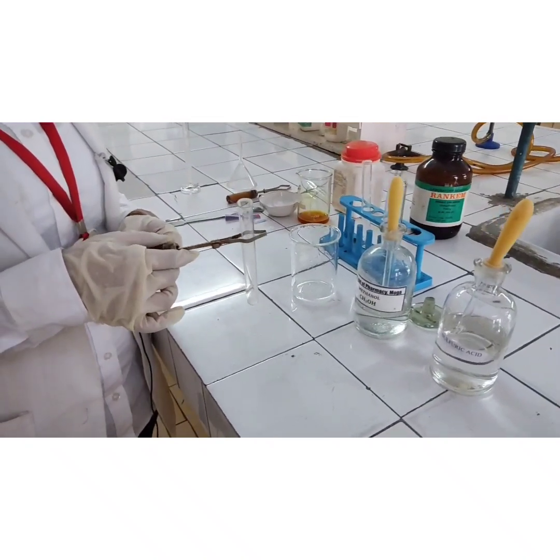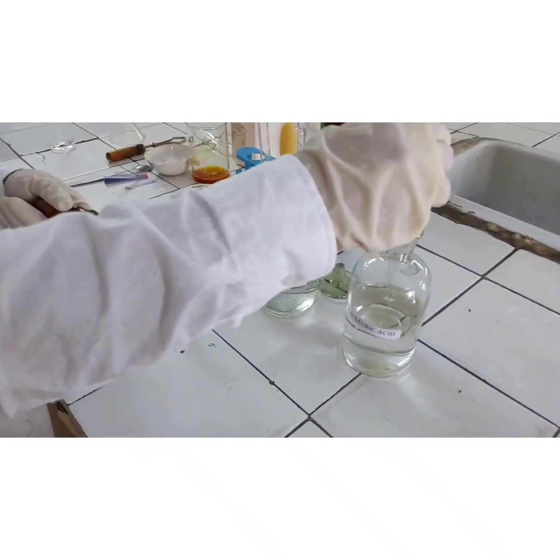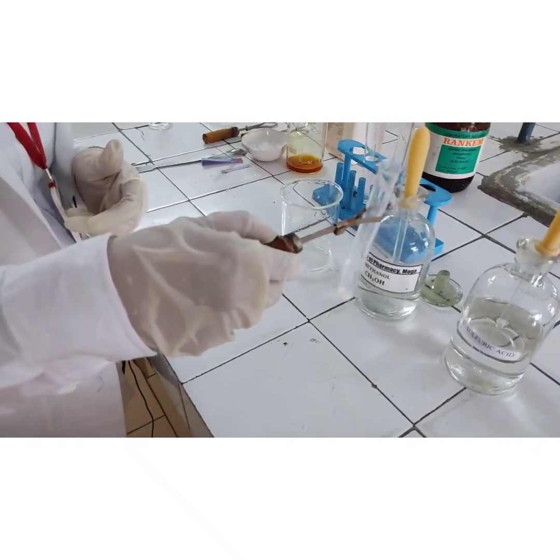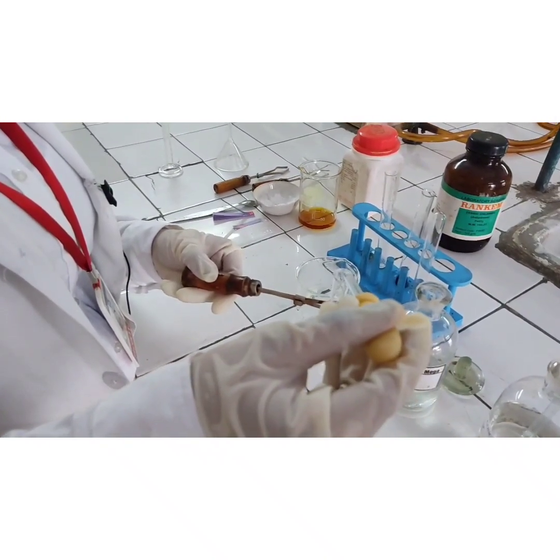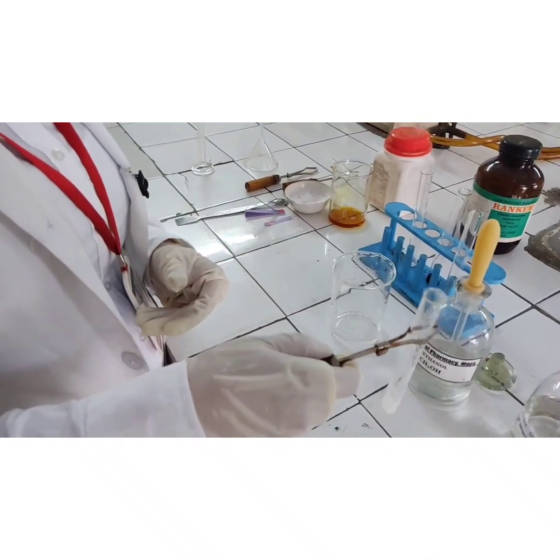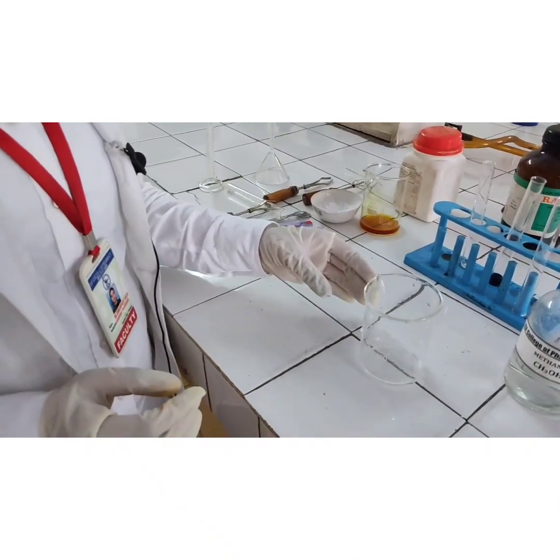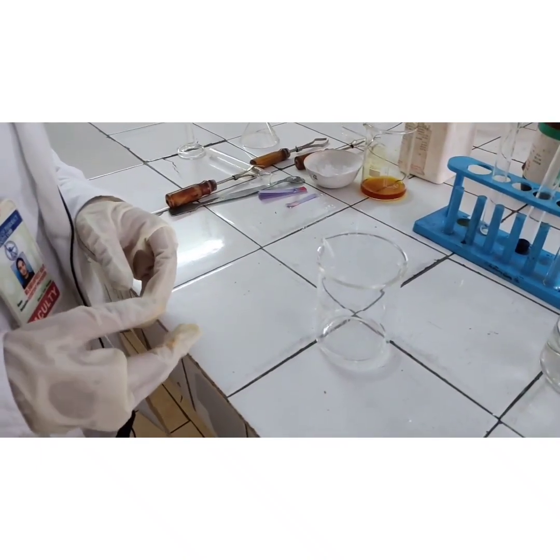Now we will perform the next test. I have taken a small amount of sample in a test tube, added 10 drops of sulfuric acid and 10 drops of methanol. The solution is then poured into 5 ml of water. Methyl salicylate has been formed in the beaker, which is indicated by its fragrance. Methyl salicylate is also known as oil of wintergreen.